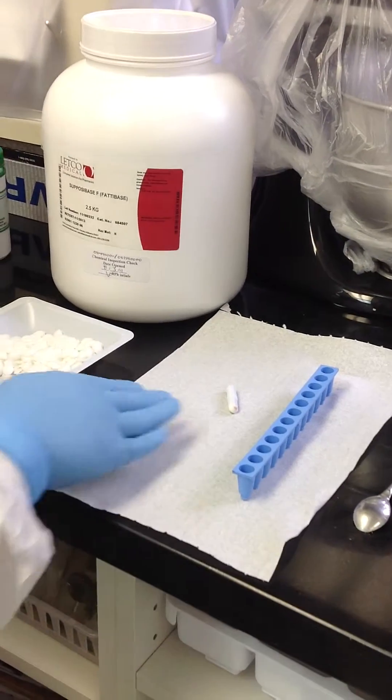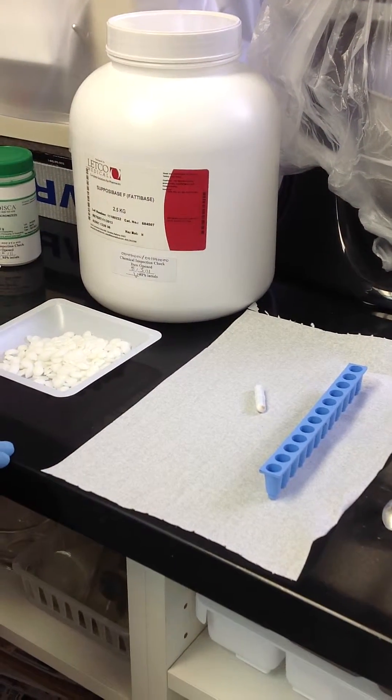We have our suppository molds right here with our stir bar. Everything has been sanitized and here we go.